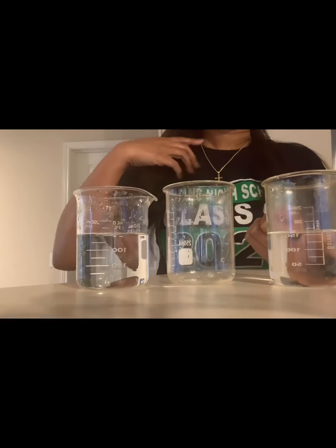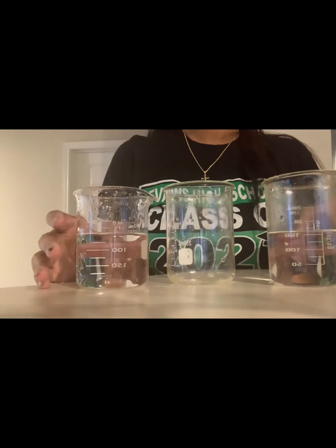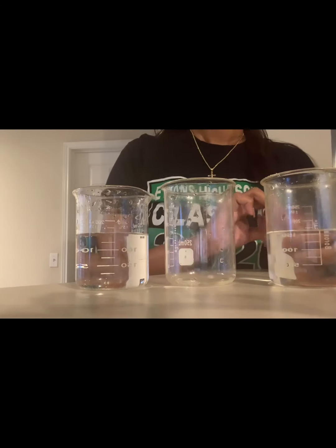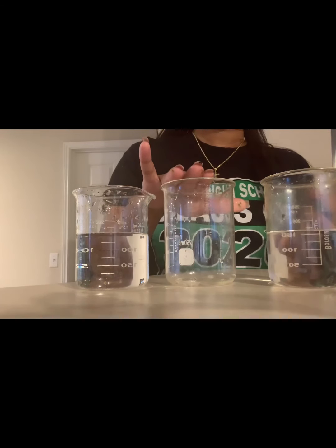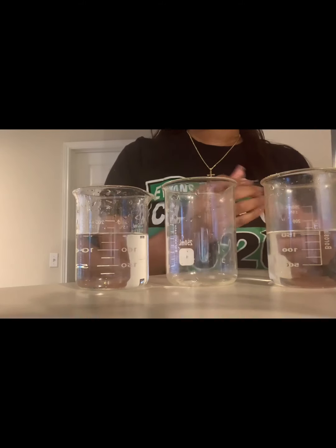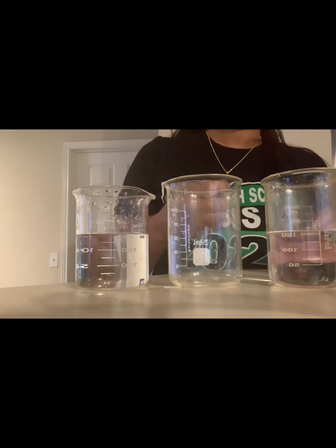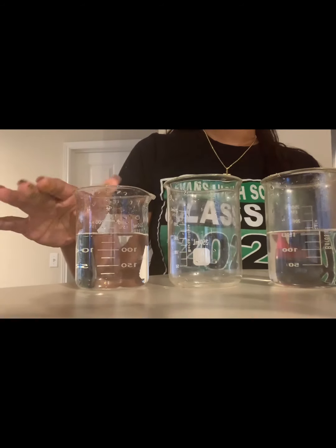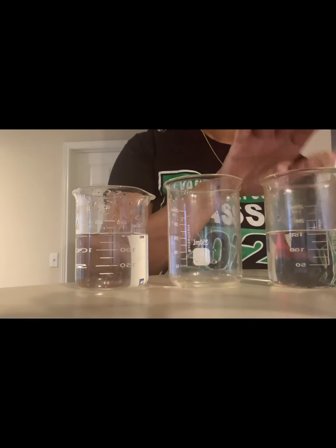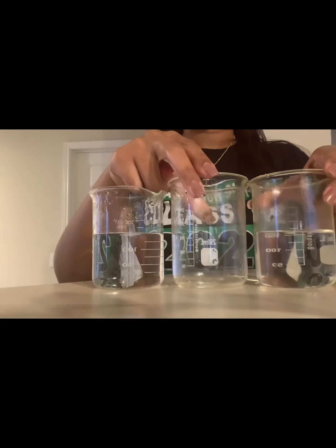Okay, guys, so now that we have gone over the background information in class, we are going to actually carry out the experiment for part one. So I have beaker A, beaker B, and beaker C. Beaker A is going to be empty. It's going to be in the middle, right? Beaker B is filled halfway with water. Beaker C is filled halfway with water, right? So they are going to be next to beaker A.